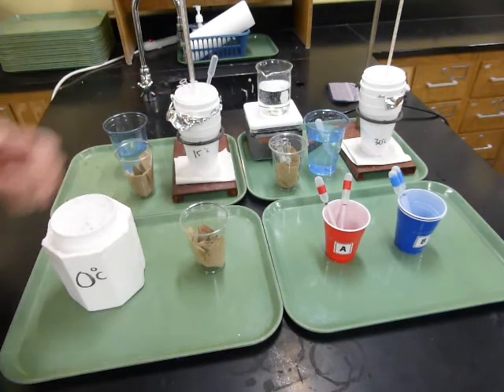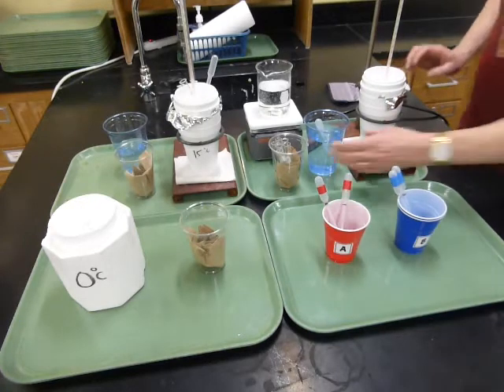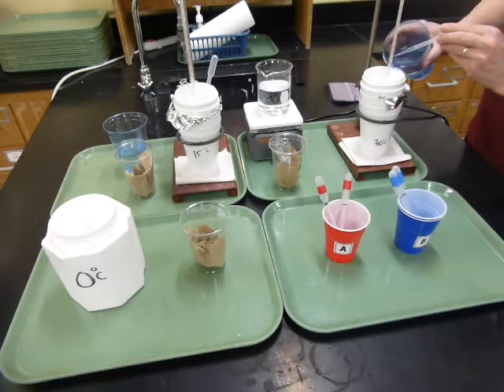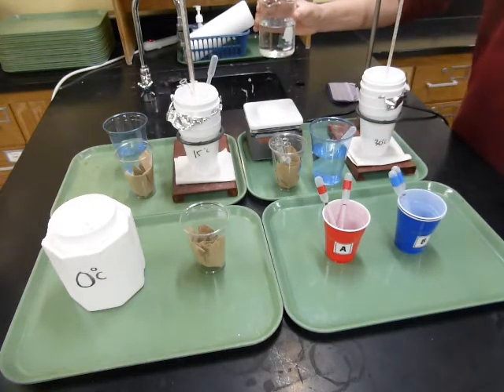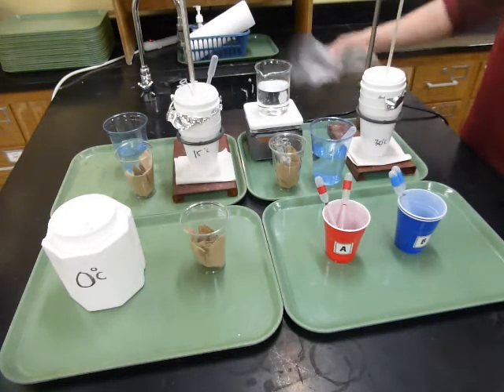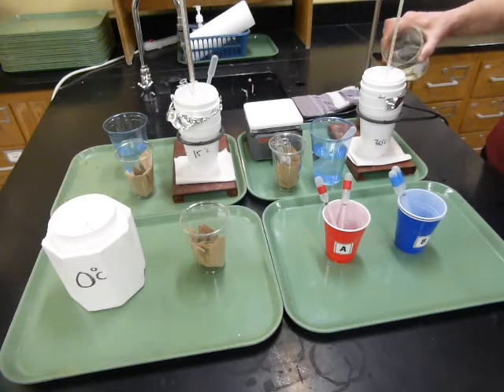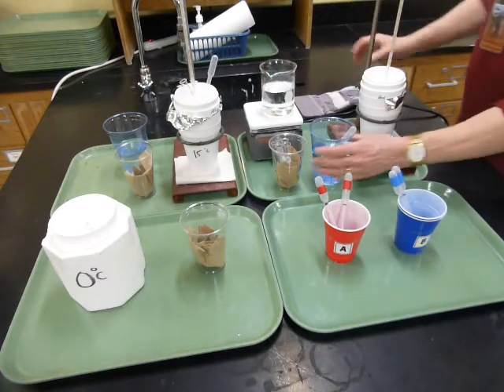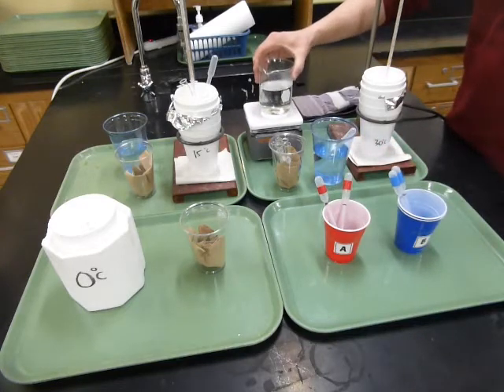Over here, the 30 degree water is a little bit warmer. So if you start with some room temperature water, which is about 20 something degrees, and you need to warm it up a little bit, then you can use the beaker of warm water that's on the hot plate. It's not so hot that you can't touch it with your hands. There's a glove there in case you can't stand the heat. So just add a little bit, check to make sure that the temperature gets to 30 degrees, and then if you need to cool it down, add more of the room temperature water. If you need to warm it up, add more of this warm water.